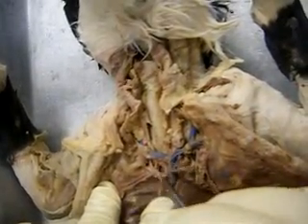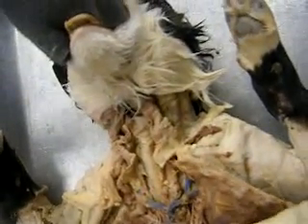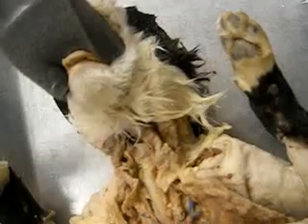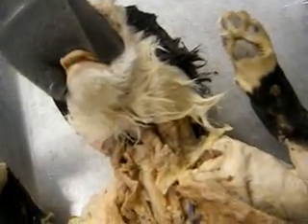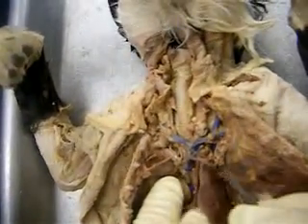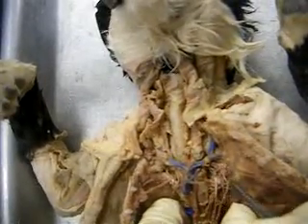What was that called again? So this is the right subclavian, okay? And then the left one, remember, is down here, and that starts off the aorta. But the right one starts up here, okay? So they start at different places. And the right one runs past the vertebral and mammary, as does the left. So the left one runs all the way up here until it gets past the vertebral and mammary.